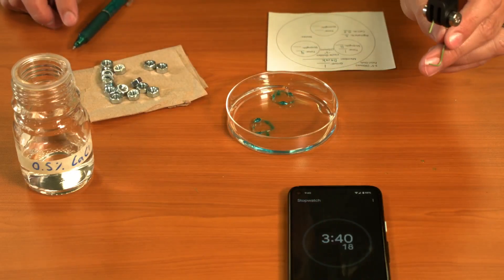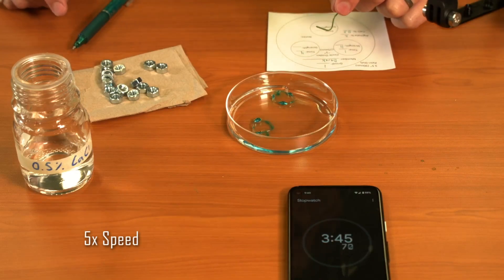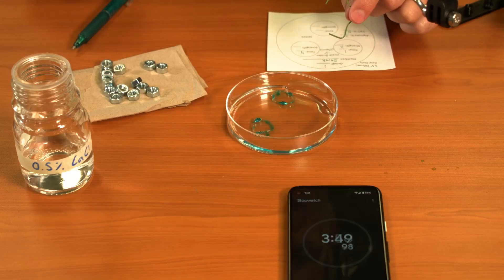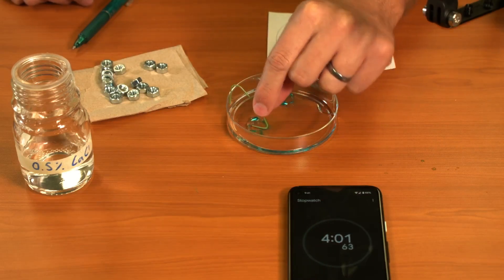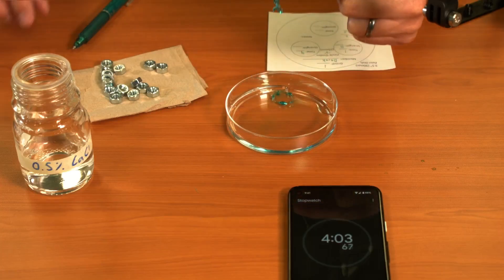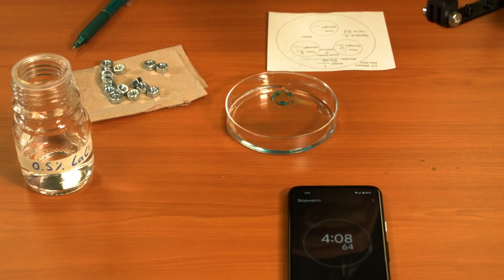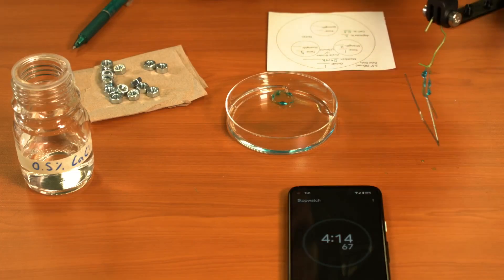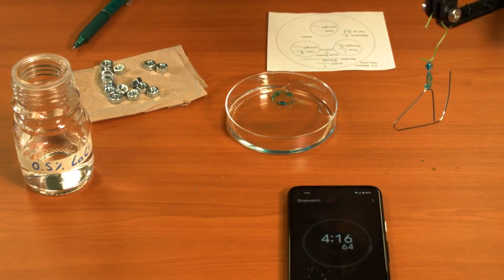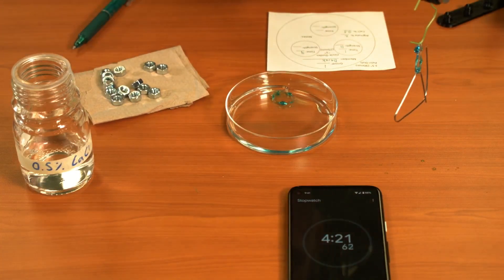Get my hook out, wait till I'm at four minutes just so that number is accurate. Again, going to suspend right here. I'm going to try and raise this up just a tiny bit and start loading.